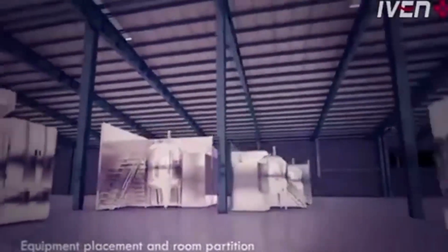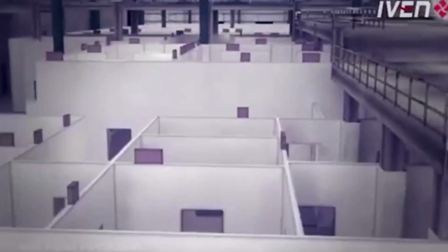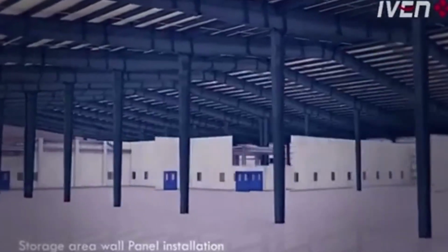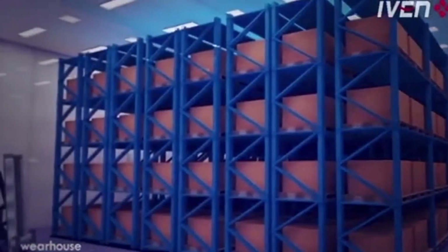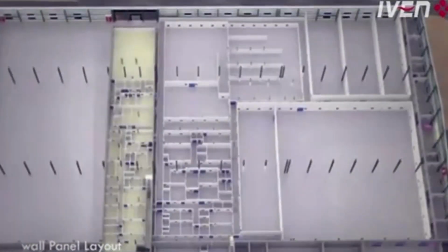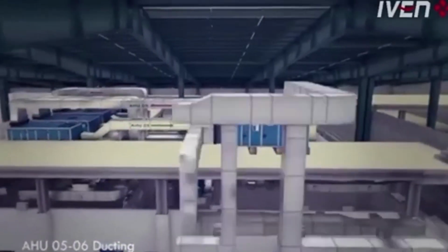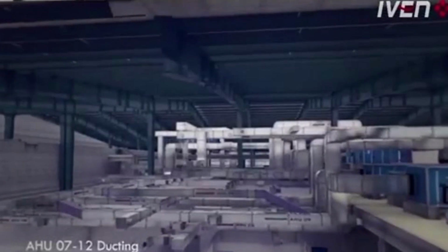All of our installation team have very rich experience. They have at least 2 years of installation experience in China for the pharmaceutical industry, so they are very familiar with the process. For the clean room, the material is very important and the skilled worker is also very important. Besides the very good quality of the clean room wall panel and door, we have a very skilled installation team. They are highly efficient and can ensure a very beautiful installation.